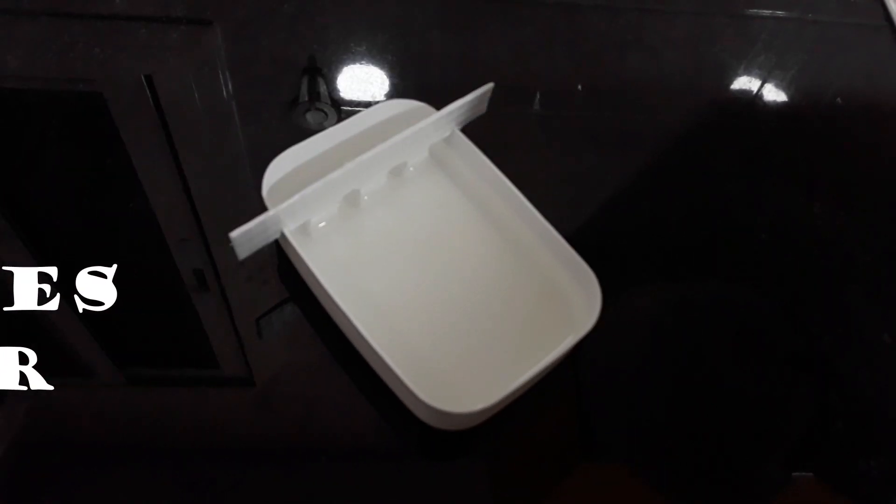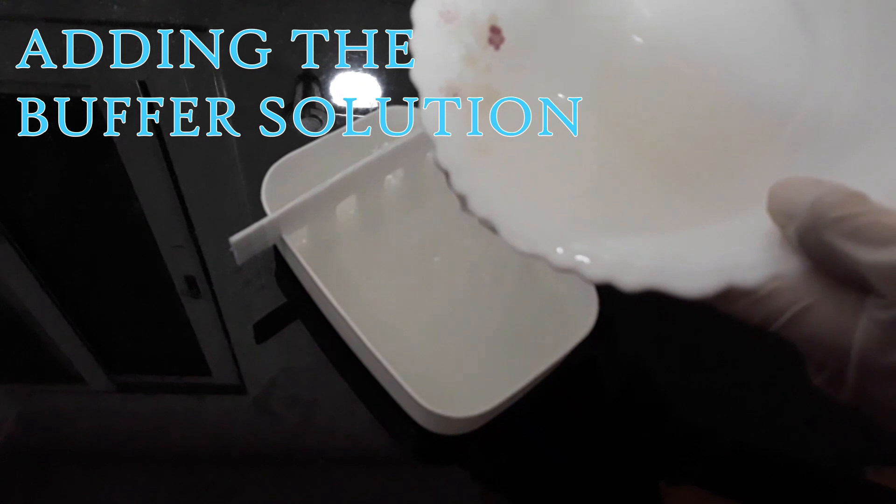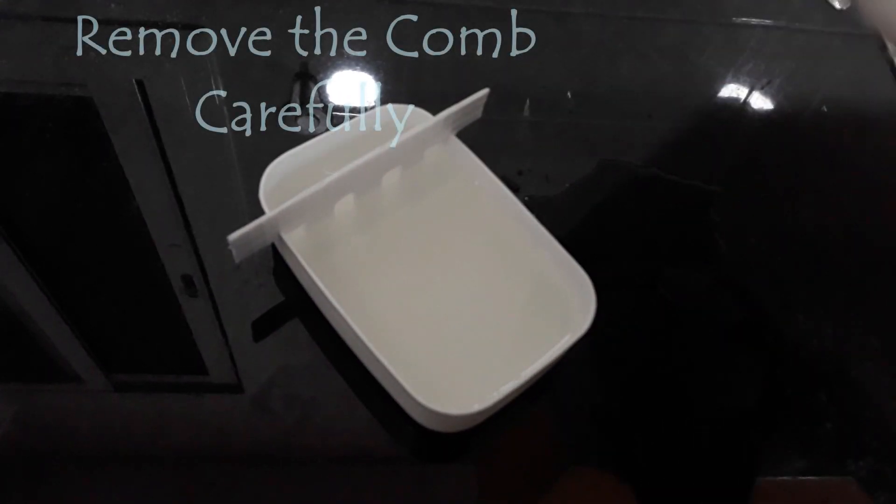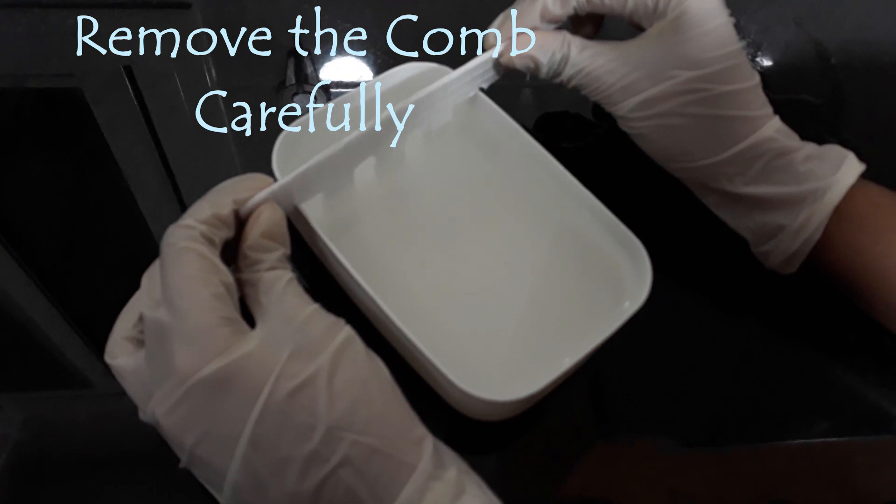After the gel has set, we are going to add the buffer solution we have prepared earlier. Next, we have to remove the comb carefully so as to not disturb the wells.